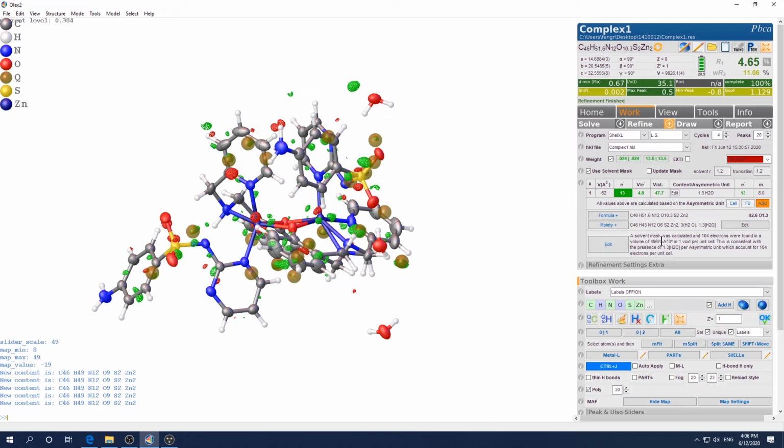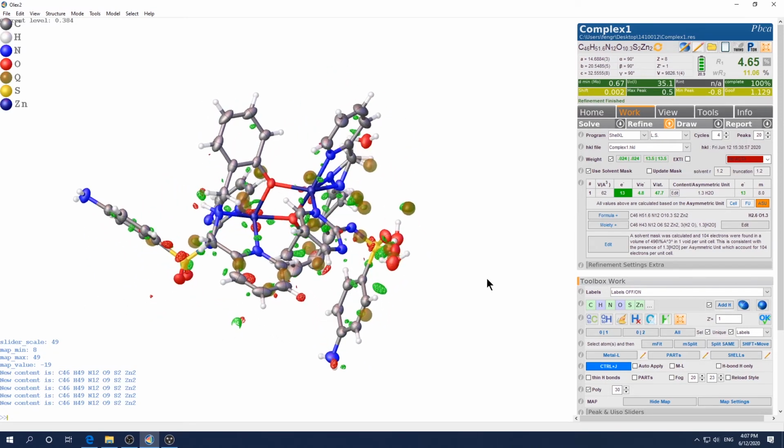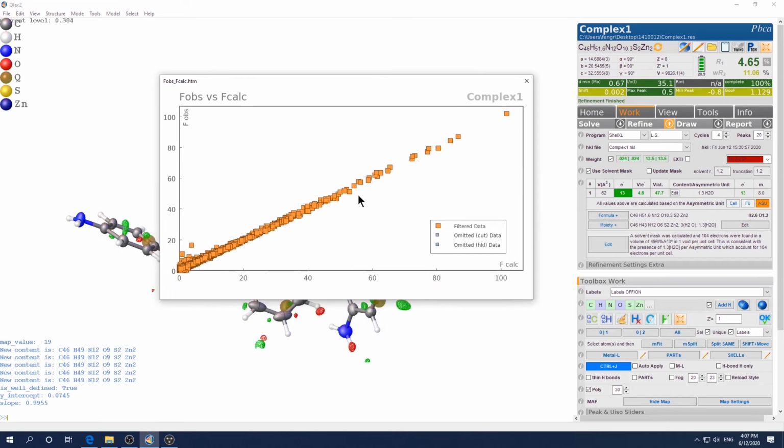And if you check here, it says solvent mask was calculated, and this many electrons were found in this volume, and this is consistent with the presence of 1.3 molecules of water per asymmetric unit, blah blah blah. Of course, you can edit this a little bit, but this default format is fine. And this all green looks perfect, and there's no strange hydrogen bonding because you modeled the bonding as a riding model, so it is restrained to be within a reasonable bonding distance, and the occupancy is also in line with their parent carbon atoms. And if you check with this major indicator, this is a perfect straight line, and you see two outliers here. It's perfectly normal to ignore a few of these outliers, and no referee will question this because this is not systematic.